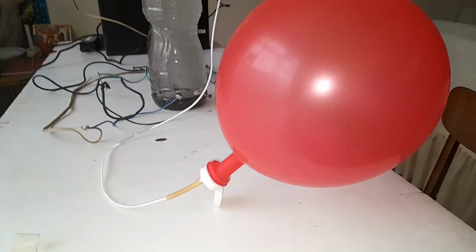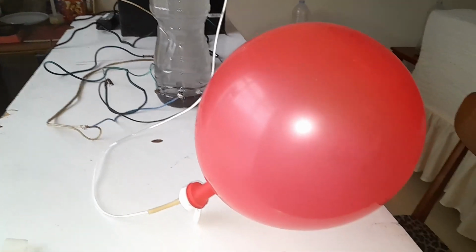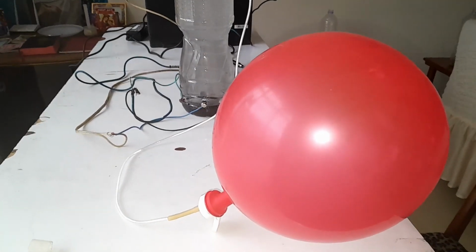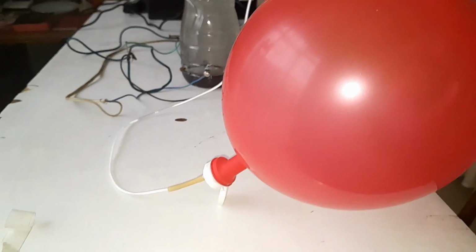It's kind of filling up, and you can see it's floating. Wow. To be honest, this is the first time I've achieved this. It's starting to float. Now a bit more and the balloon will finally float and we're going to see. Well guys, I think I made it. It may not be much, but I made it. It's a floating balloon filled with hydrogen, oxygen, and some water vapor.